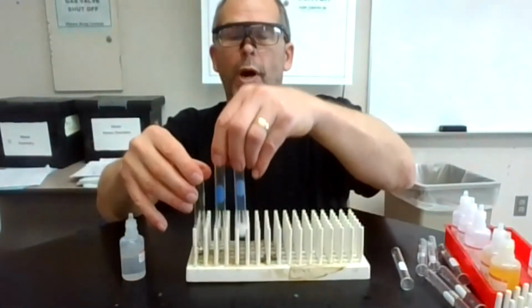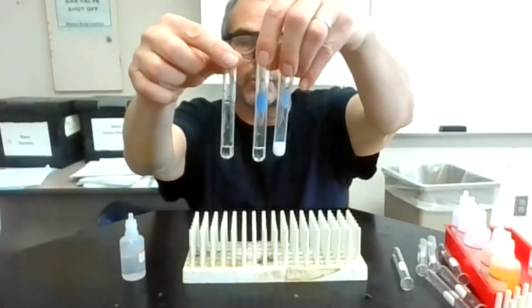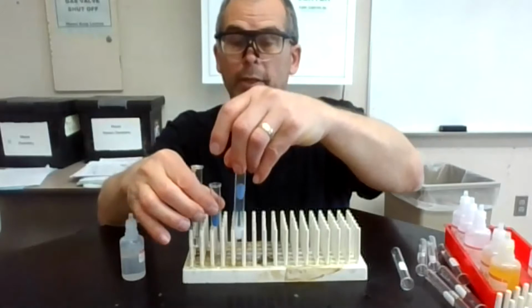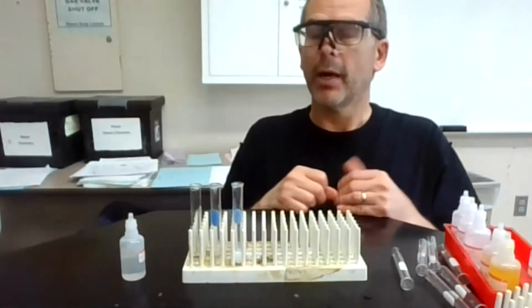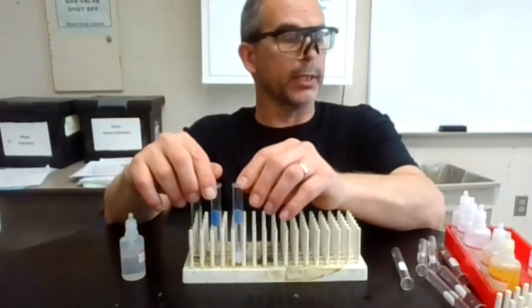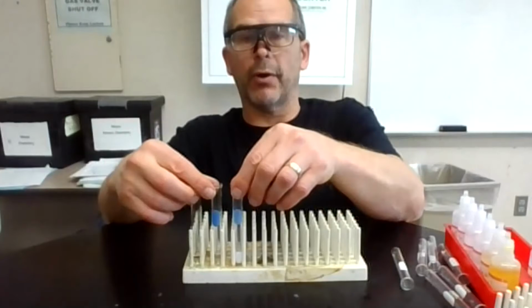So it looks like just 1 out of the 3 had a distinctly cloudy reaction. That was the silver, making silver chloride. That looks like a good way to separate silver from the other 2. So hopefully they aren't all the same. Otherwise, if everything's the same, you wouldn't be able to come up with a separation scheme with these cations. Okay, so that's the first column of this.